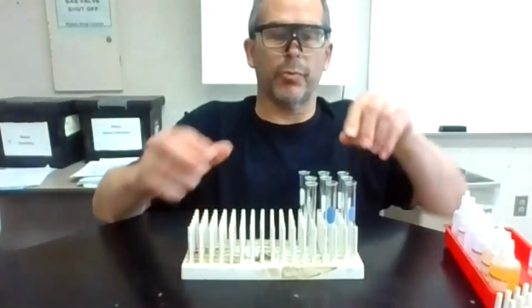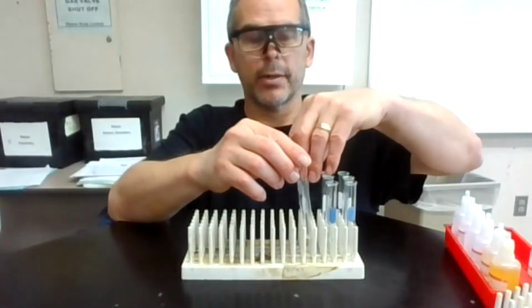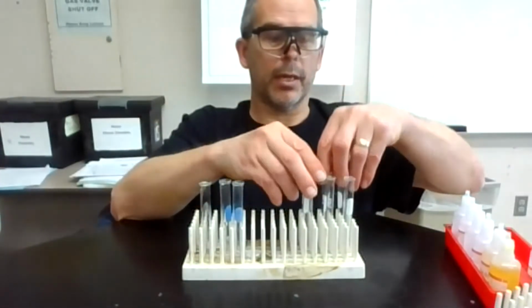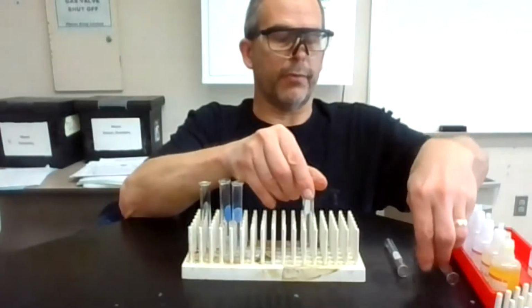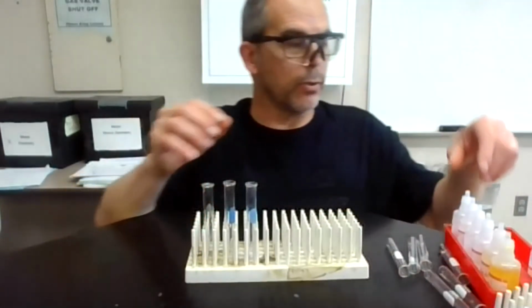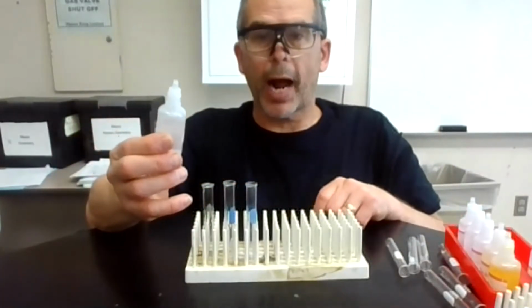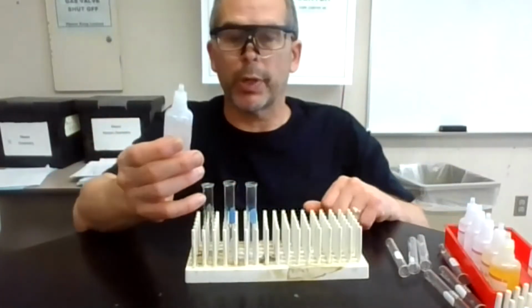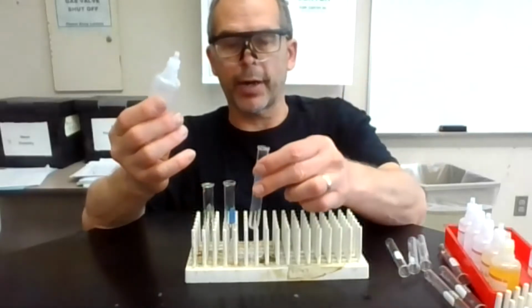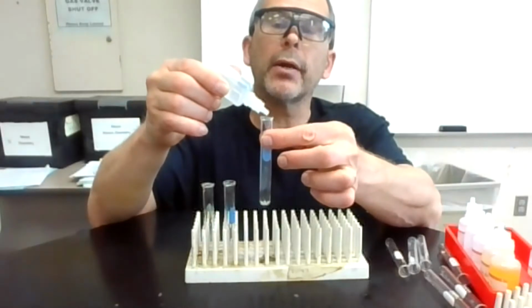And I have this test tube rack, and I'm going to take 3 test tubes out right here. All right, I'm going to use those. And let's put these on to the side for now. And then what I want to do is take some silver right here. We're going to assume 10 drops makes 1 milliliter. Okay, I already rinsed these out. I get a little bit of that extra water out right there. And I'm going to add 10 drops of silver nitrate.